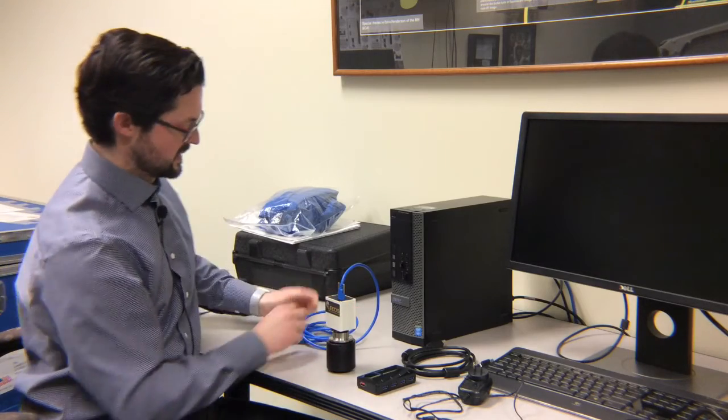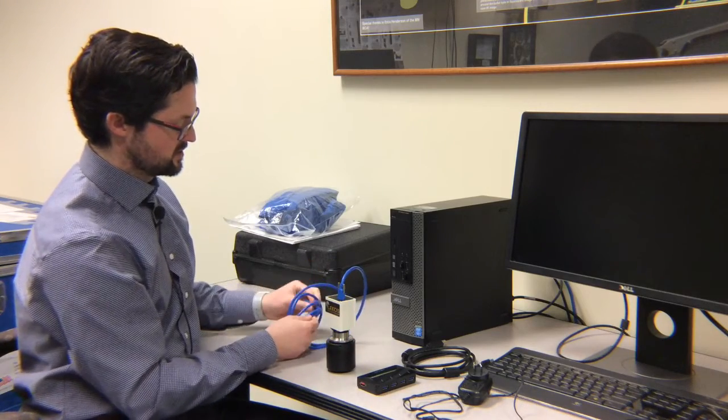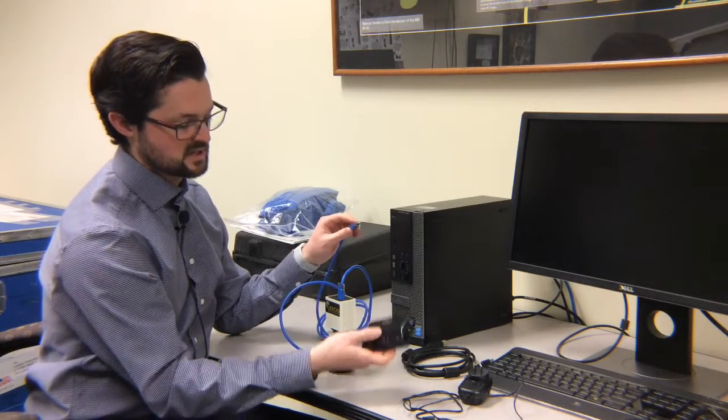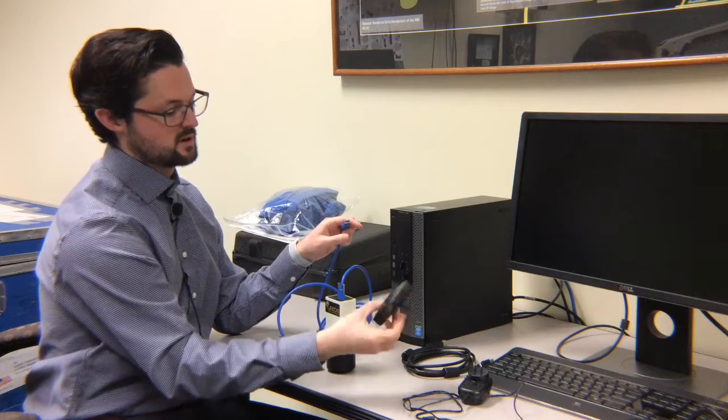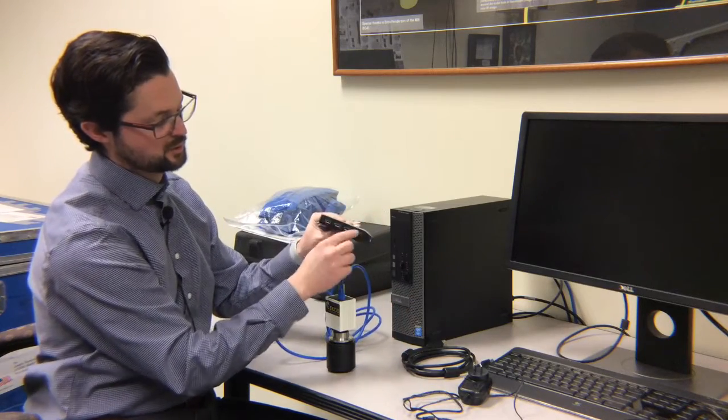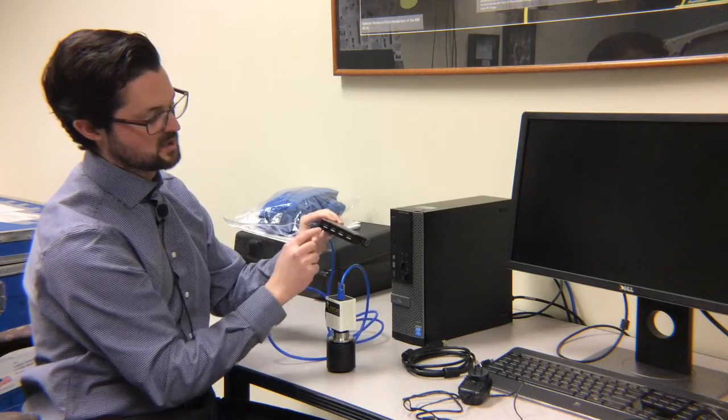Okay, your next step is to attach your six-foot USB cable to your StarTech powered supply hub. You'll notice there are some labeled ports on the side, one through four, and they're blue. You can plug into any one of these ports.